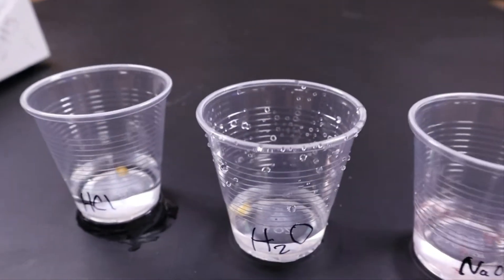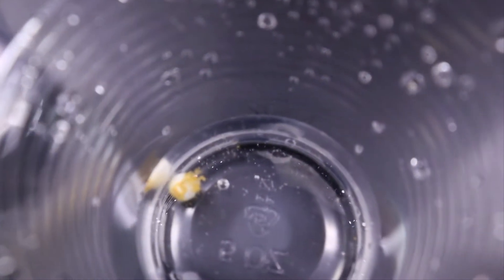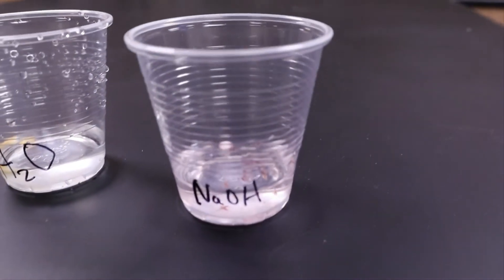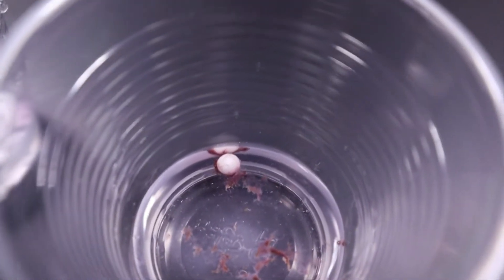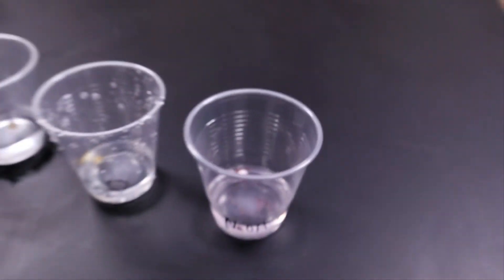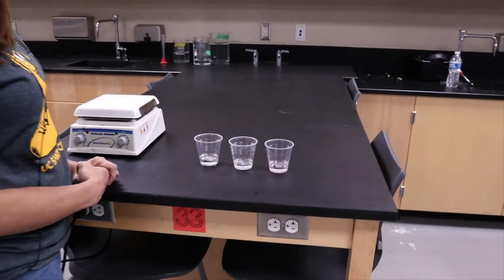The pill in the water, which represents the large intestine, had a little bit — it looks like it's hanging off a little — but not very much happened with that one either. The final example, the sodium hydroxide representing the environment of the small intestine, had a lot of movement. You can see there is a color change and a lot of dissolving has happened.